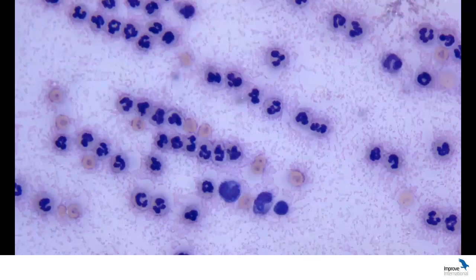So again, I'm going to ask that very recurrent question. What we're seeing here is mostly neutrophils. Do we think these are degenerate or non-degenerate? Just do the D or N for answer. We're getting N's. Non-degenerate, absolutely. I'm so glad, and I really wanted to have this reinforced because there were some people who struggled with this during our session. So it's good to see that it's coming through.